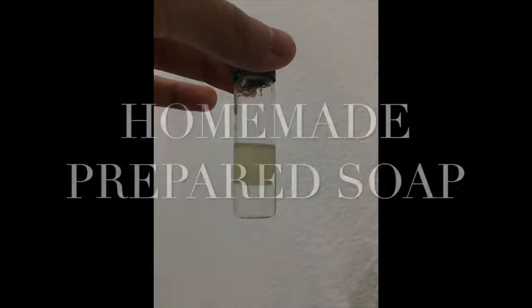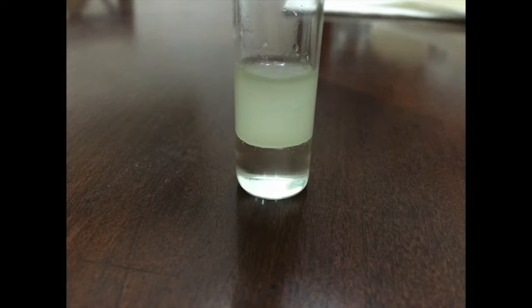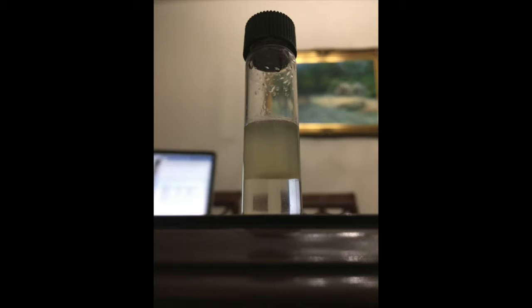In the saponification of fatty acids lab, the preparation of homemade soap was compared to that of commercially made household soap. After 24 hours and observing the vial, there was a solid layer between the layers that could be seen. Upon this observation and completing the remainder of the lab, each test tube could be observed to be different from one another.